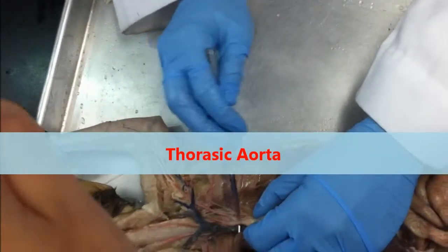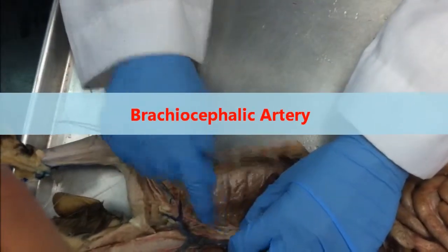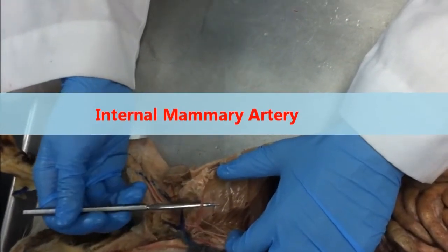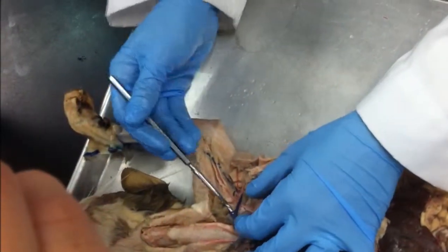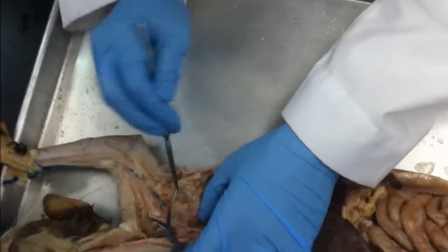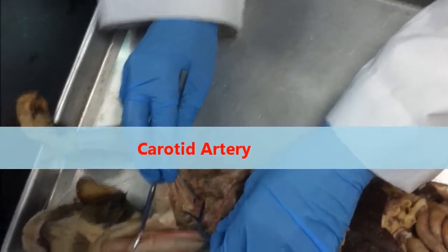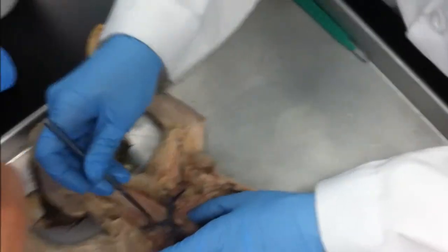This is brachiocephalic. This is technically just brachial, but we still call it brachiocephalic. Okay? This is the easiest to identify. Mammary. Internal mammary artery. Okay? From the internal mammary artery, I'm going to go up. Technically, both of these are brachiocephalic. From here, going up to what? Carotid artery, sides of the neck, jugular vein, carotid artery.